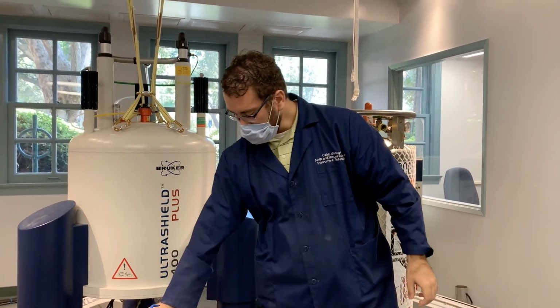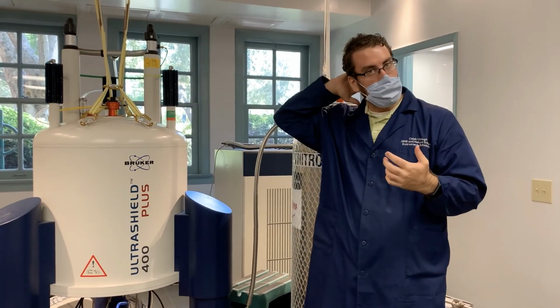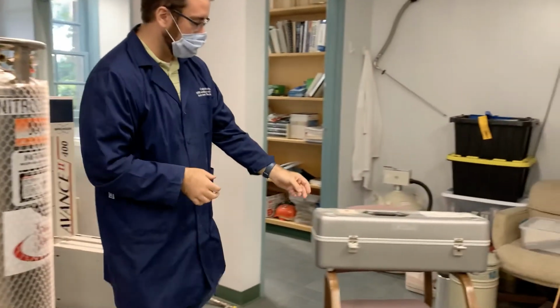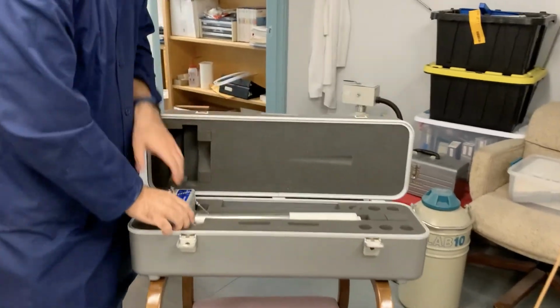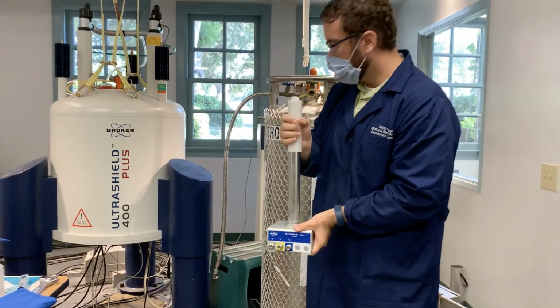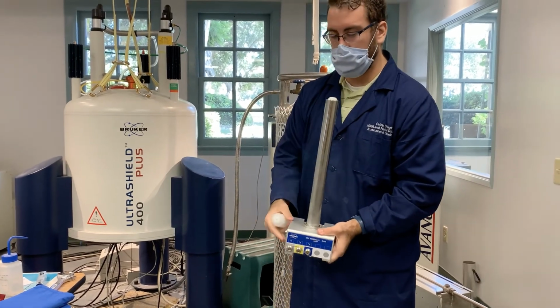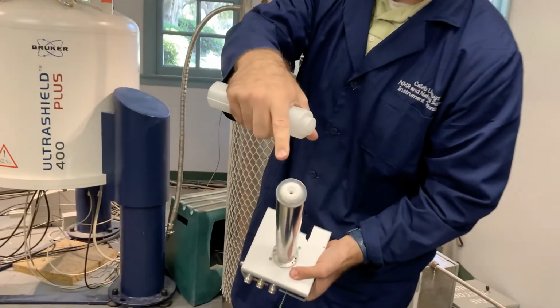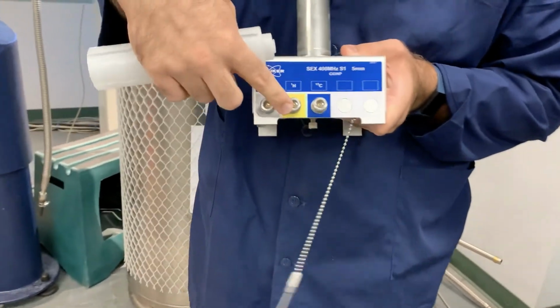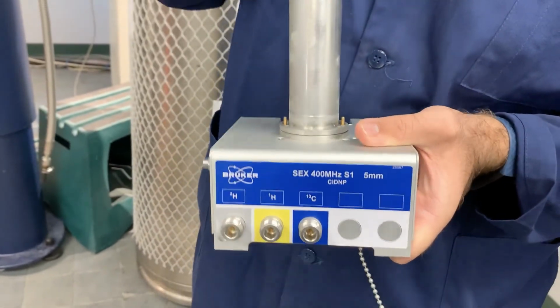Another interesting thing then with the NMR is you have a probe, which is what you use to look at the different elements. So I have one over here that isn't currently in, and I'll pull it out. So this is a probe, and there's currently one in the instrument that is in the center, and it has this little spot in the top, if you can see, and that's where the sample will rest. And then it has 3 different nodes here, and that's what we're tuning to the different frequencies for different elements.